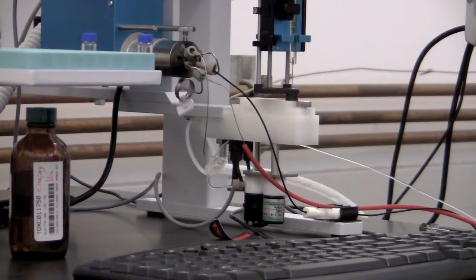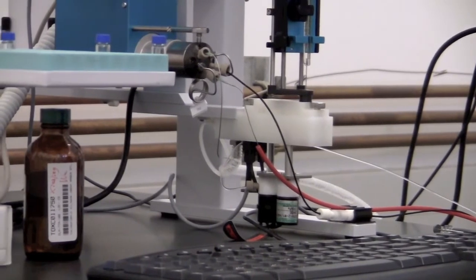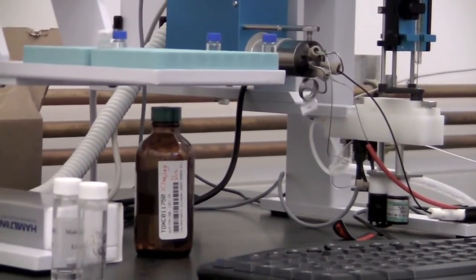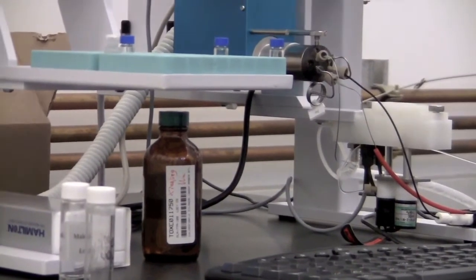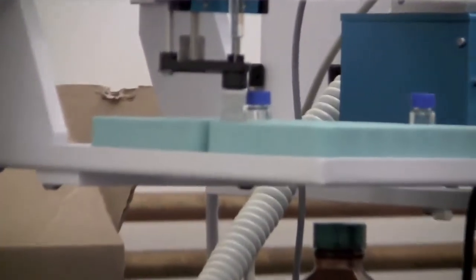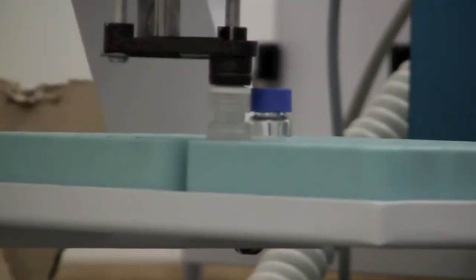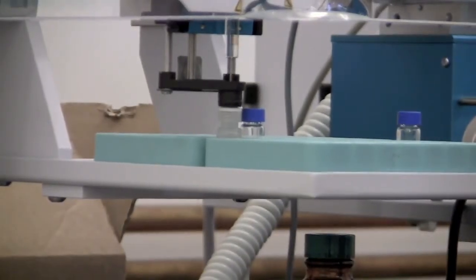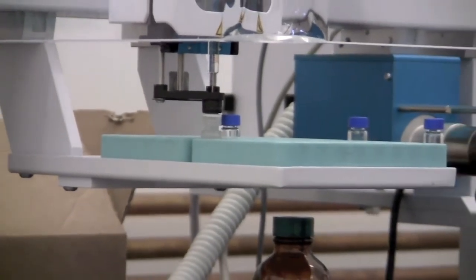After it's finished washing, it's going to load your sample. Your sample should be between 25 and 50 microliters in volume. The loading volume is 22 microliters, so you want to have slightly more than the loading volume. So it's going down now, loading 22 microliters of sample from the bottom of the vial. If you have more than that, it doesn't matter, but it won't be loaded into the system.